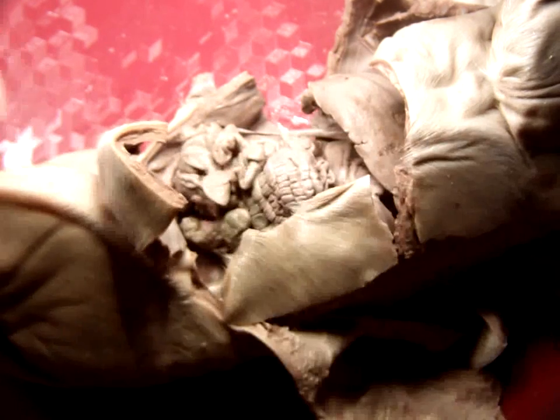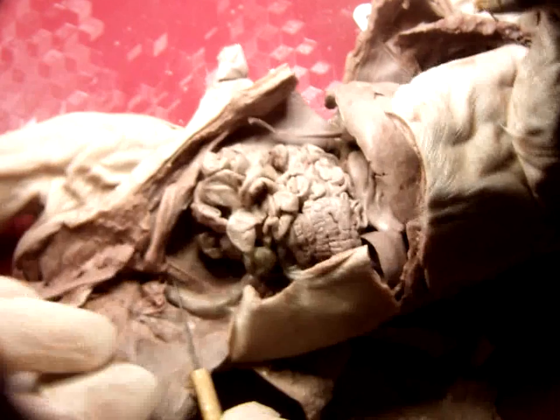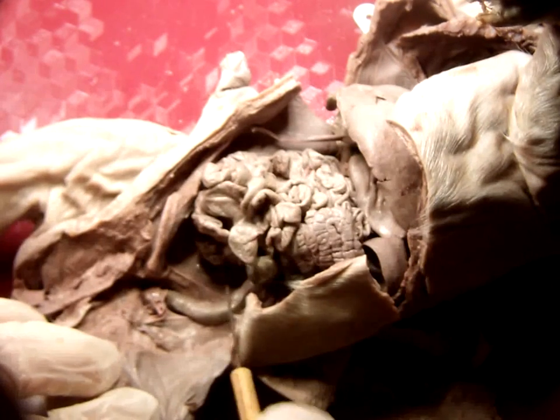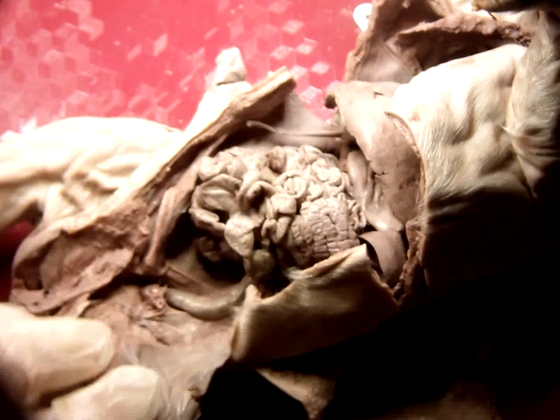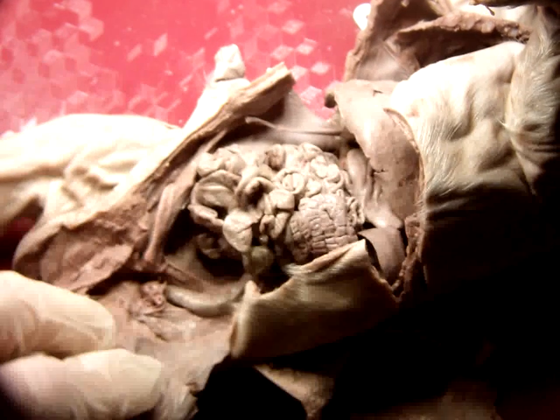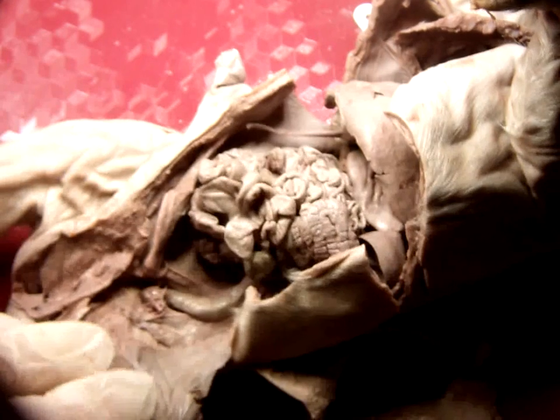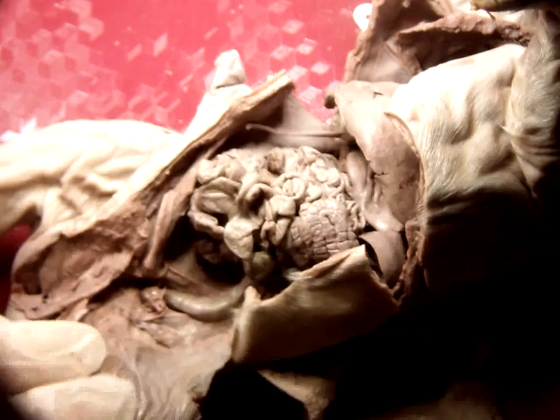But above that, or superior to that in us, is this last section of large intestine right here, and that last section is known as the rectum. That's what fills with fecal material to be exported, if you will. So when this fills up, that's when it tells our brain, hey, we've got to drop this off someplace. Okay. All right.